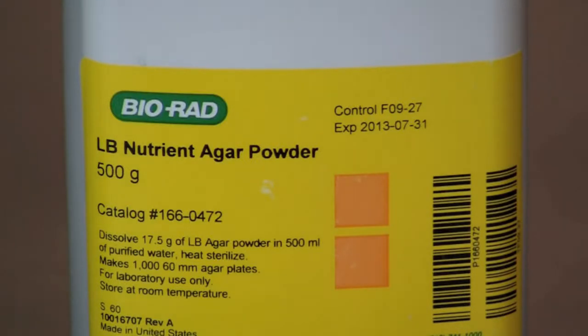For this activity we will be making 100 milliliters of microbiology media using LB nutrient agar powder.